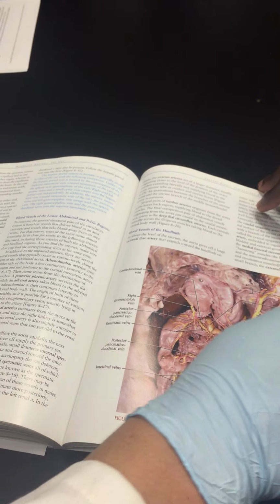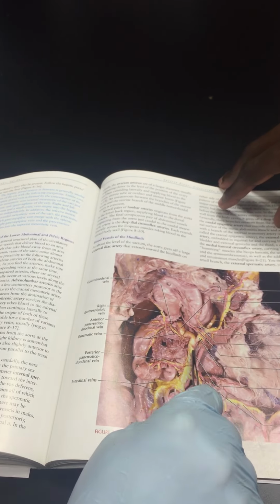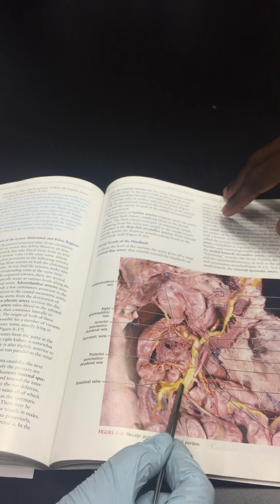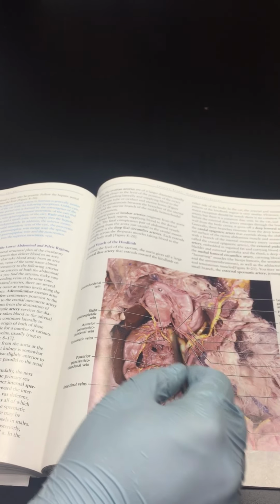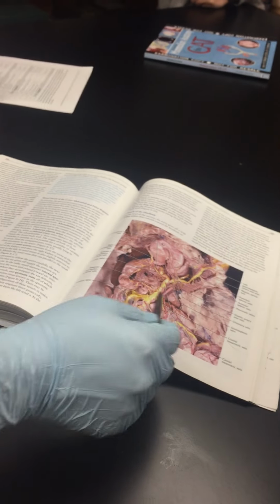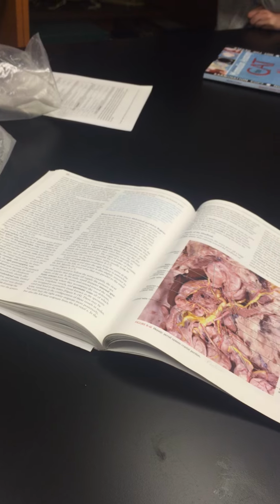So the hepatic portal vein is the last part, and I would ask about this one, cranial mesentery vein, hepatic portal vein, and the splenic vein. So what happens is, this is the cranial mesentery vein. There's a big one, and it will merge with the splenic vein, and the common part at the end is called the hepatic portal vein. Okay. At least you should know this part, and this part. Major, the anterior mesentery, splenic, and form the hepatic portal vein.